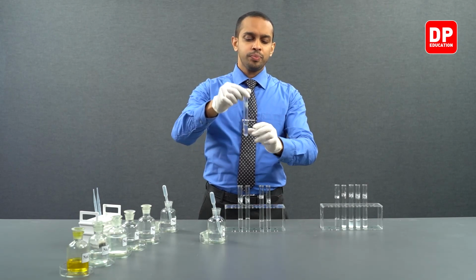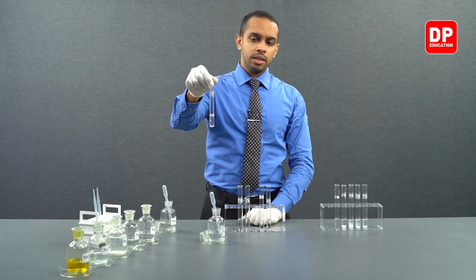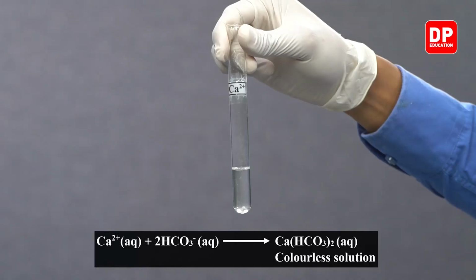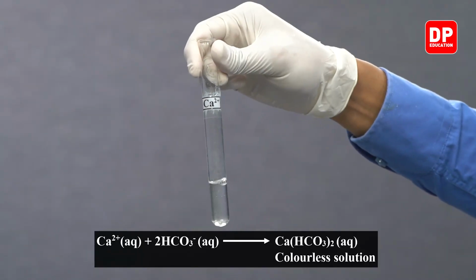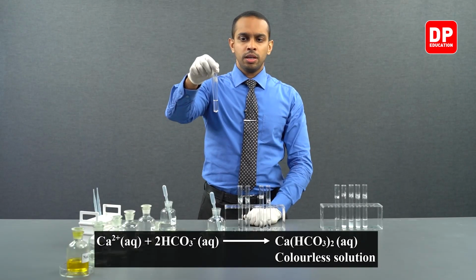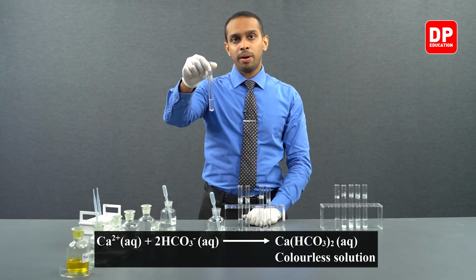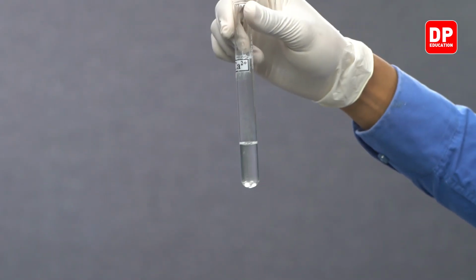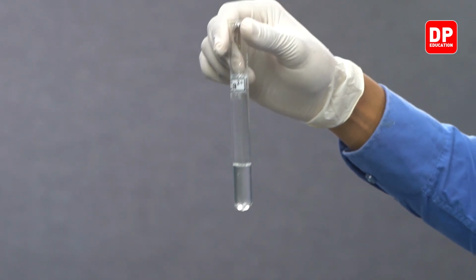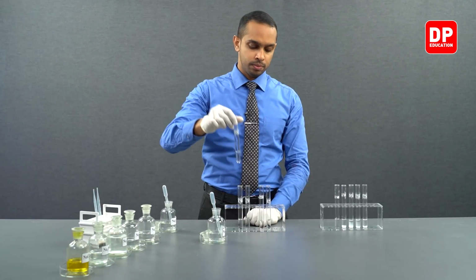As you can see, when you add sodium bicarbonate into calcium 2 plus aqueous ion solution, we do not form a precipitate. In the presence of bicarbonate ions, calcium ions will form calcium bicarbonate. Calcium bicarbonate is water soluble.